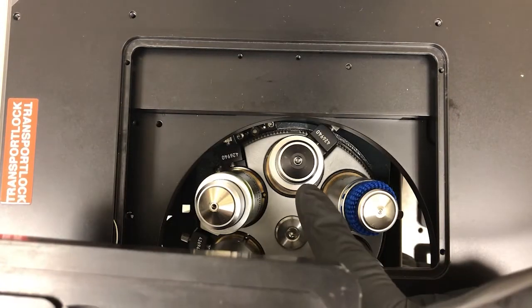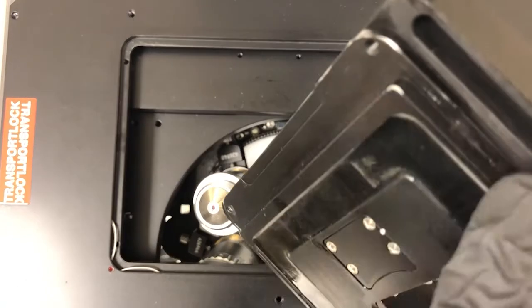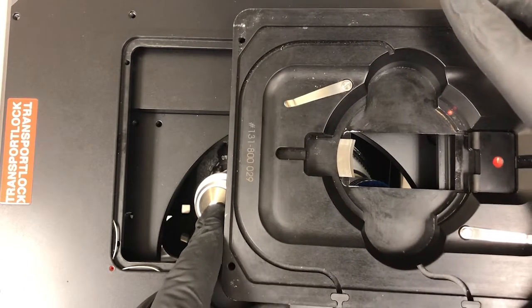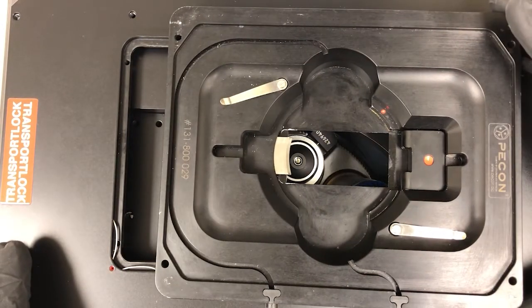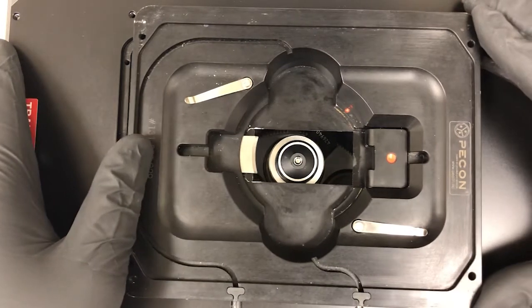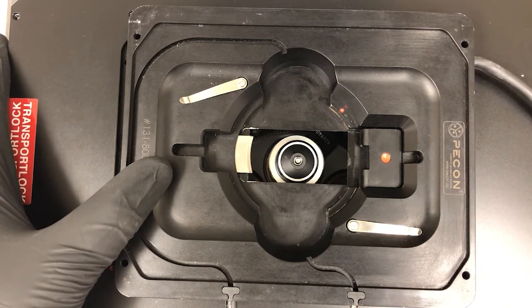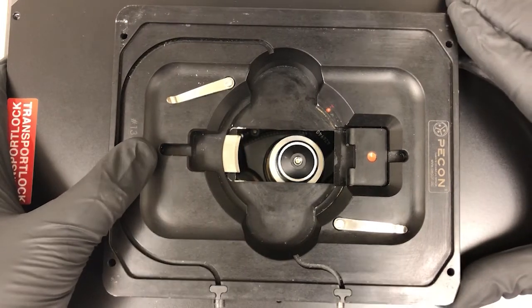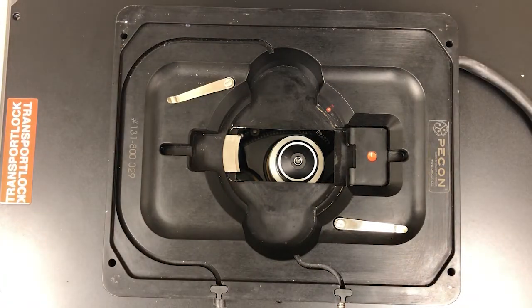Again, we want to verify that the 10x is in position and it's all the way at the bottom, which it is. And so now what I'm going to do is, remember, I need to put this groove in this. So the way I find it easiest to do that is to place it here and feel until I can feel the groove in. And if it's in, it'll slide easily from left to right. So I'm just going to hold it gently and slide it from left to right, bracing with my left hand against the side there, just as we do when we place a normal stage insert, and then just pull it and gently push it until it drops in position. It's quite heavy, so it'll drop by itself, and you shouldn't be able to move it, okay?